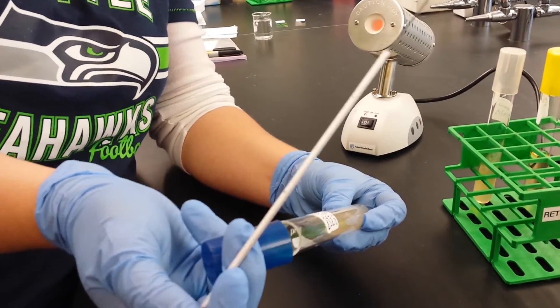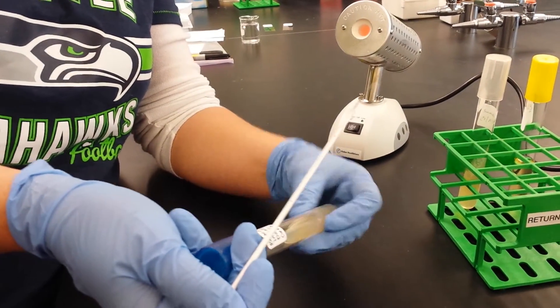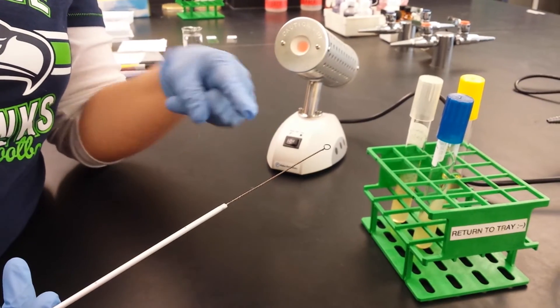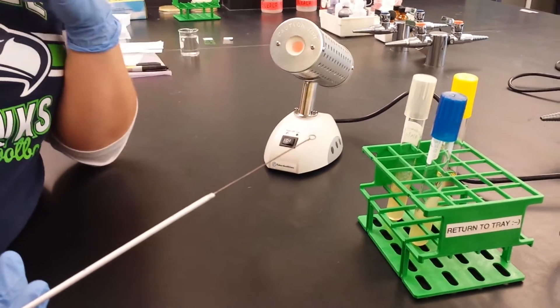And then again, see how I bump into the side, and put the lid back on like so. So now we're done with the transfer, but we have a live bacteria on this loop, so we need to sterilize it.